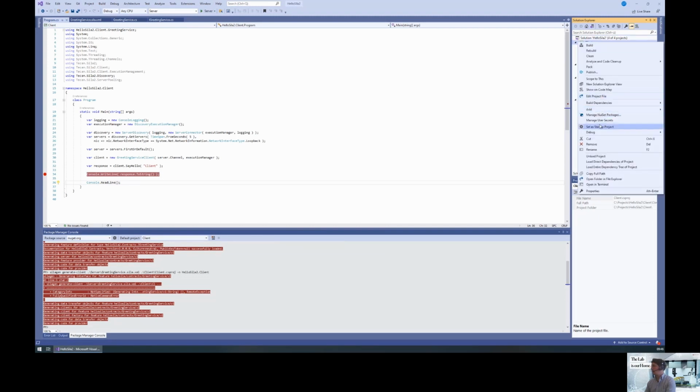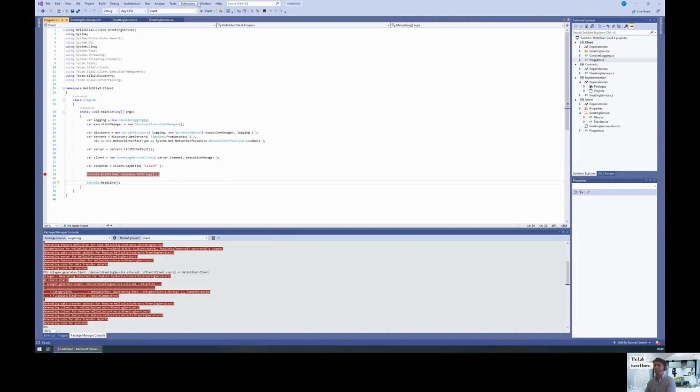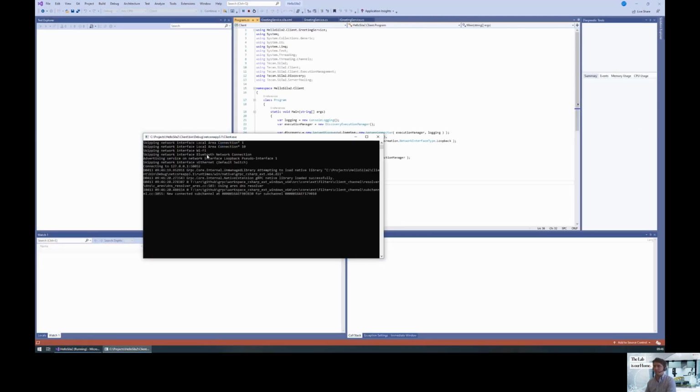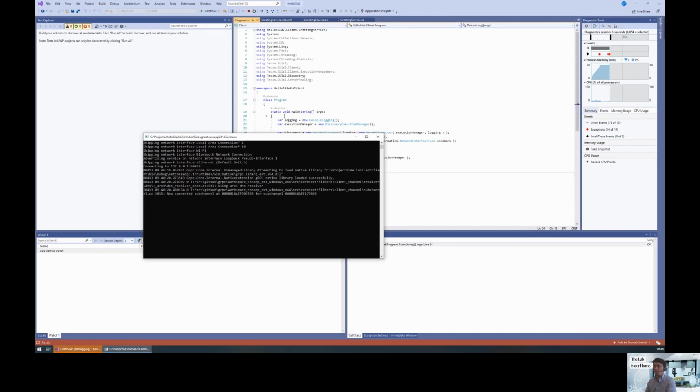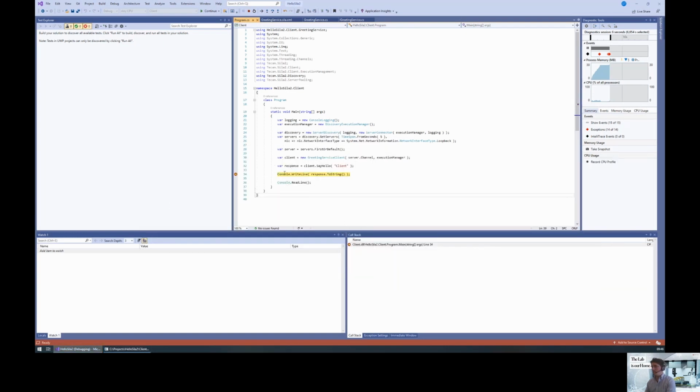And then let's start the client. So we have this 5-second delay for the discovery. And then it's going to hit the breakpoint. And the response now is a dynamic object property. It's not going to fetch the identifier that we had, because that's not transmitted via SiLA 2, but we have a value, so we have a type, and that type is a string, and the value is "Hello client", as we expected.